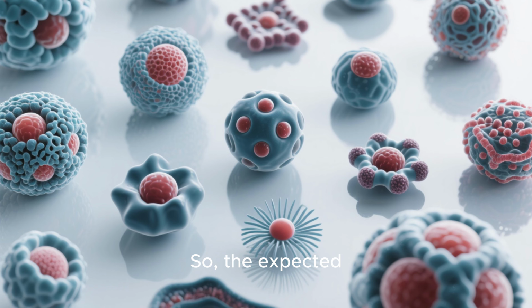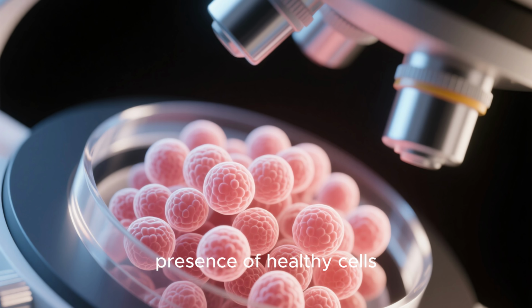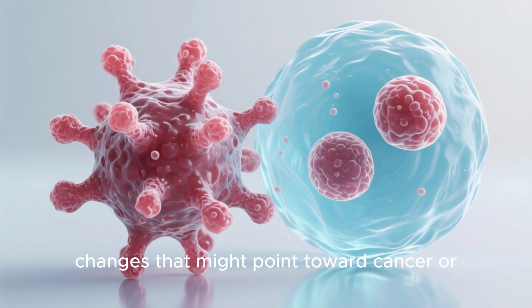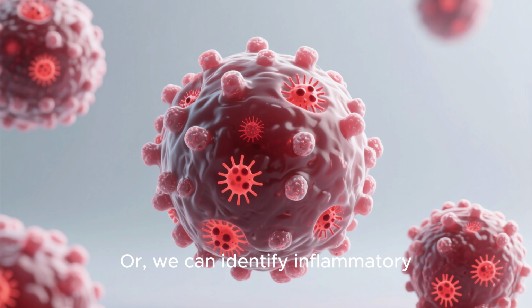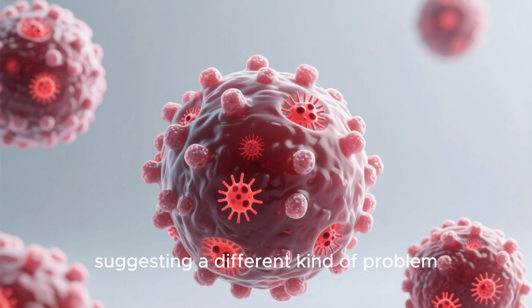So, the expected results fall into a few categories. We can confirm the presence of healthy cells, which is great news. We can detect early abnormal changes that might point toward cancer or precancerous conditions. Or, we can identify inflammatory or infected cells, suggesting a different kind of problem.